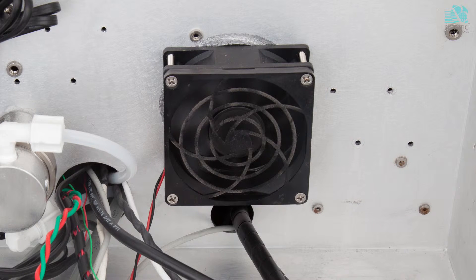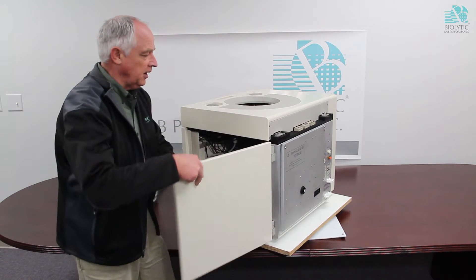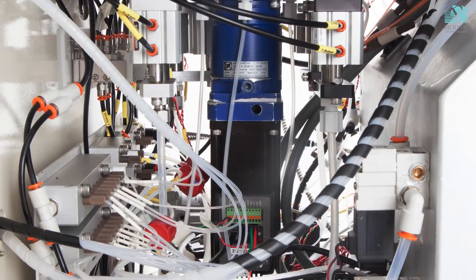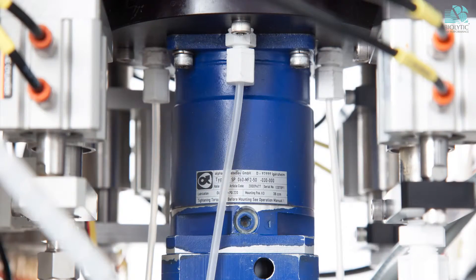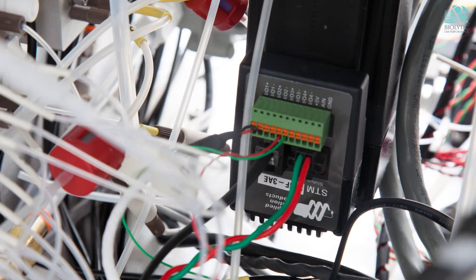This is on the other side of this wall. So now we're going to take a look in this side. We can see again the additional fast drain and the slow drains up in here. This is the new motor and the motion controller encoder and motor are all built into one unit.